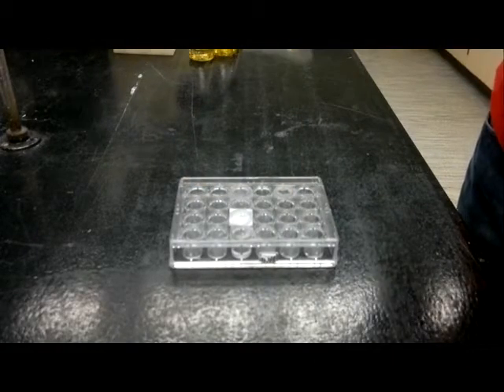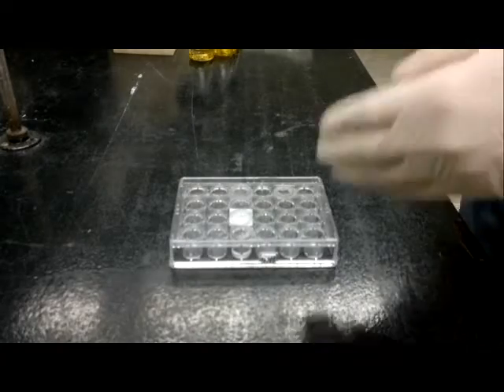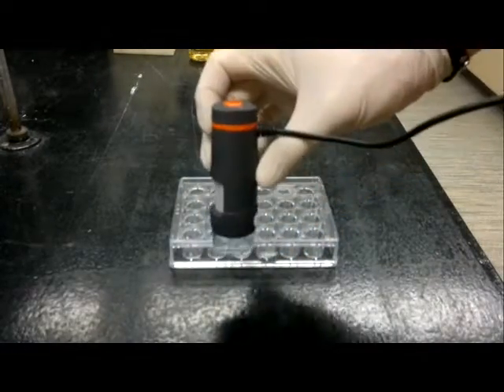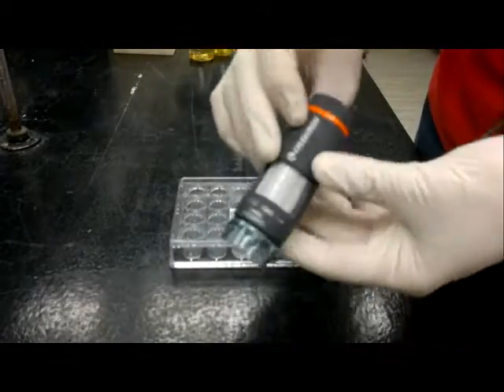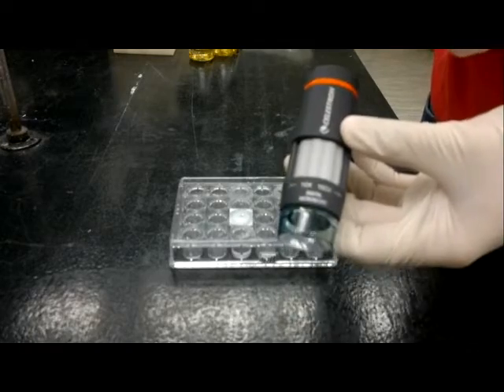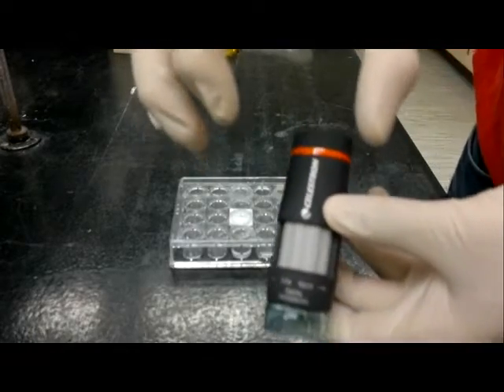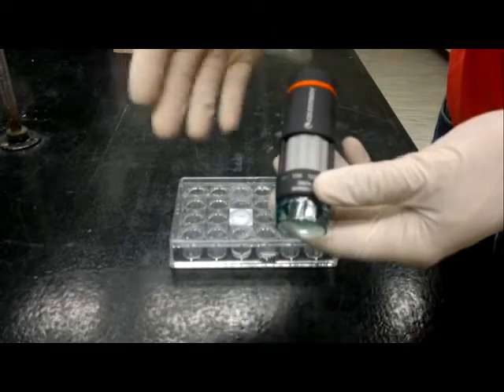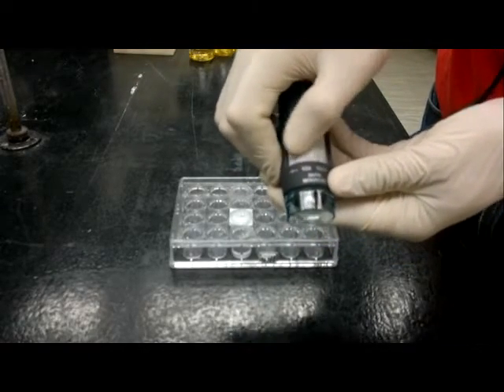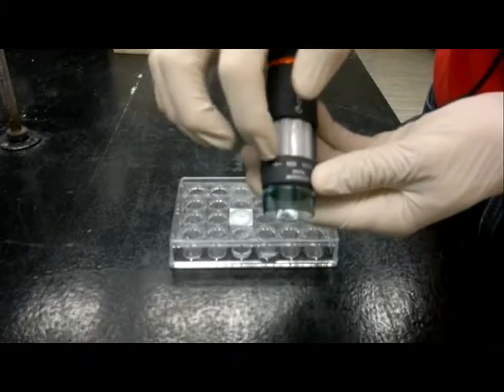So what we're going to do is basically do a survey of our cover slips using the handheld USB powered microscopes that I've provided for you. Now, if you have a look on the microscope, it lists from a 10x to 150x magnification. I'm doubtful that it's actually 150x but they advertise it as such. If you rotate this dial down towards the 10x magnification, maybe not quite all the way, and then have a look at the screen.